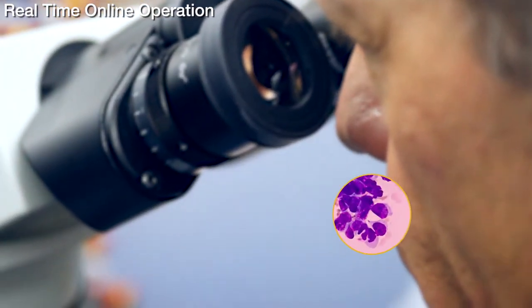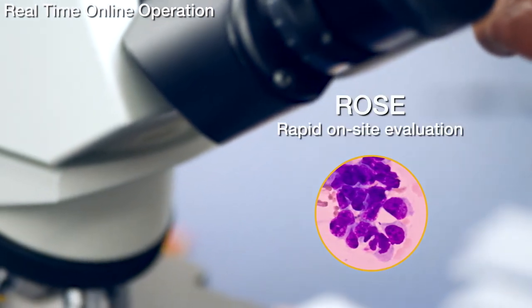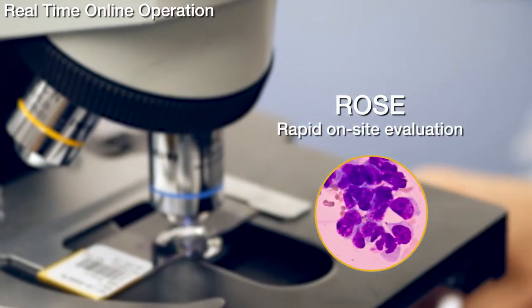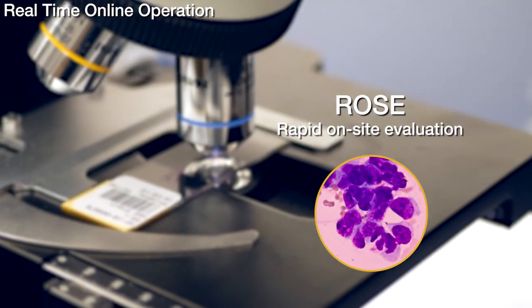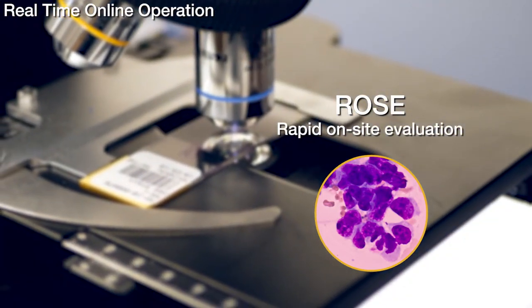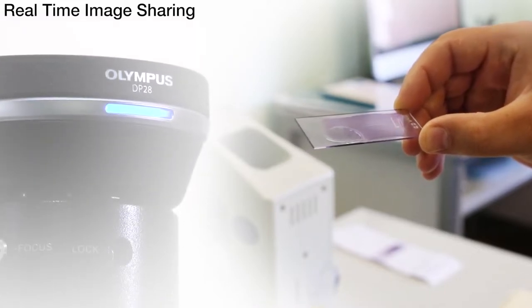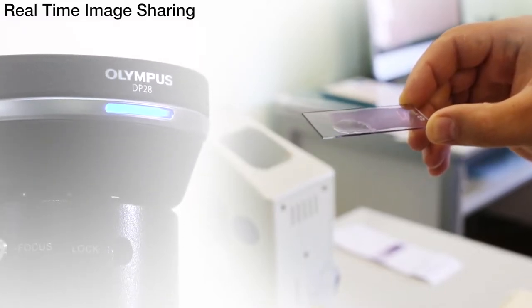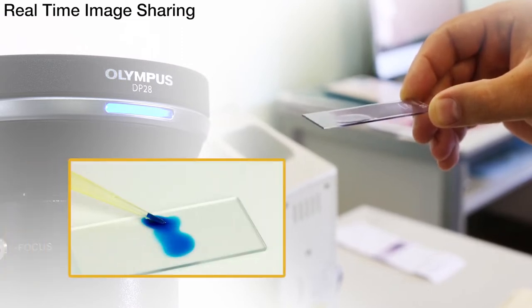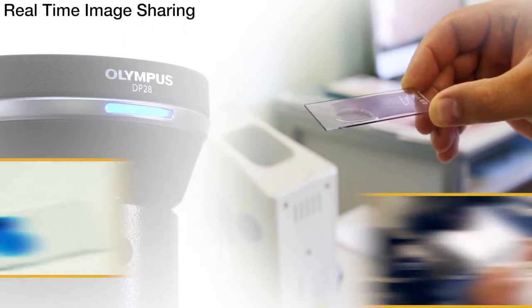One application where the network solution is commonly used is Research with ROSE, or Rapid On-Site Evaluation. ROSE enables you to assess the adequacy of samples and whether there is sufficient material to evaluate later. For example, the microscope and camera might be placed near the endoscopy room to rapidly check collected material. The specimen can be quickly stained and its adequacy evaluated under the microscope.